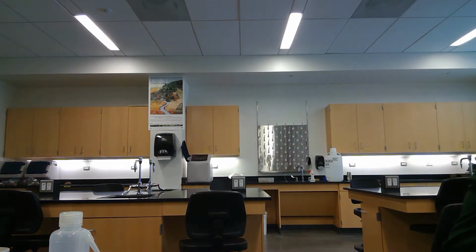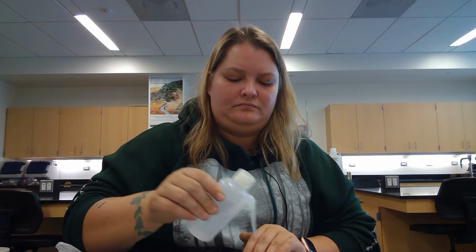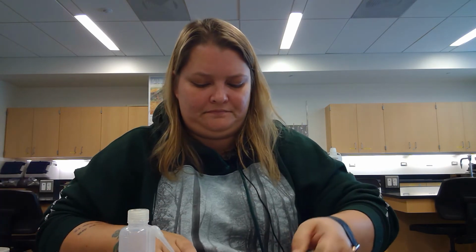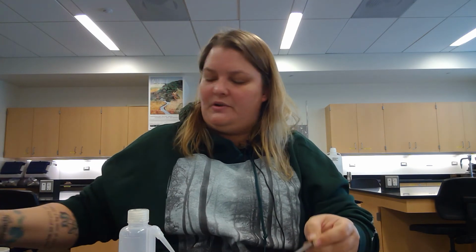Do the same thing for our fine soil. This one's going to take a lot more water.